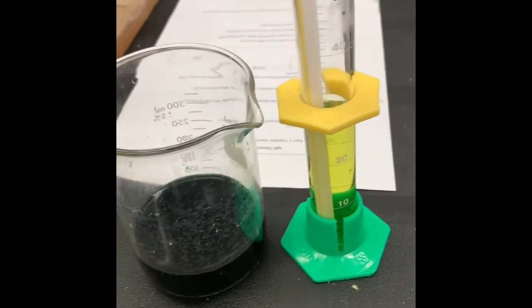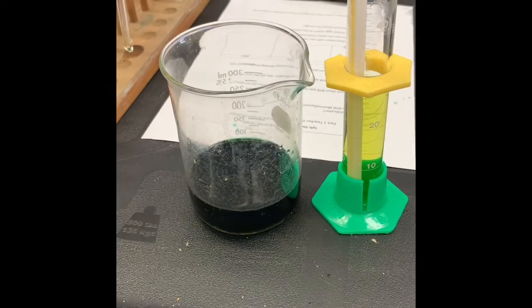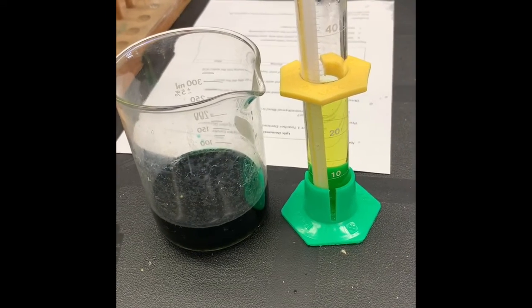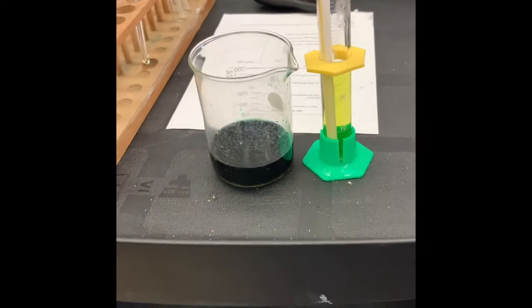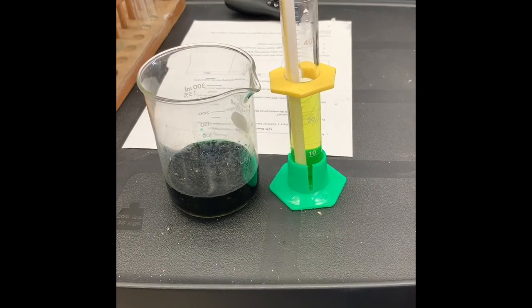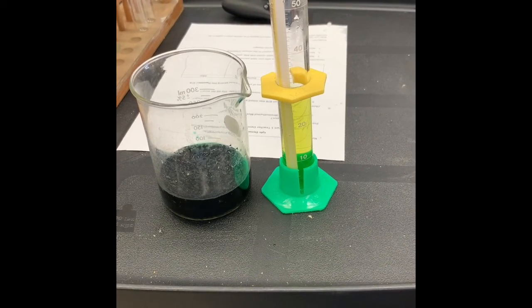When air was blown into the water mixed with BTB, what happens? Describe the color change with respect to the amount of blowing. At first, when I was blowing, what did you see happen? The more that we blew, what happened? And then, what chemical compound do you think caused that change? After your discussion, I want you to make a prediction with your partner. What do you think will happen if an aquatic plant is added to the test tube and left over time?